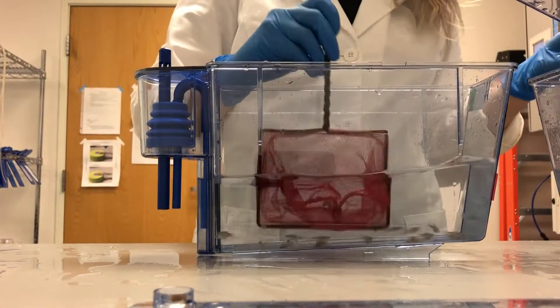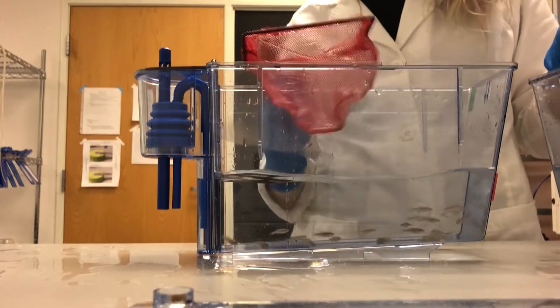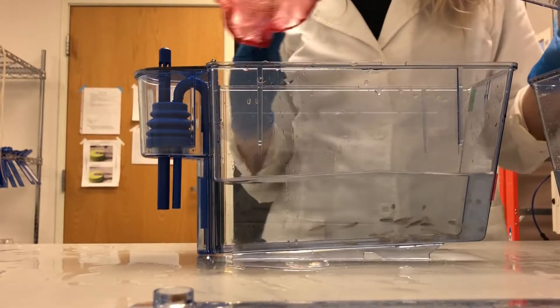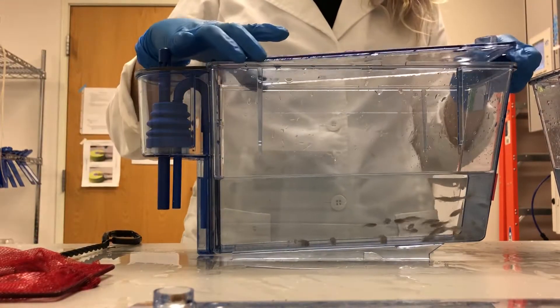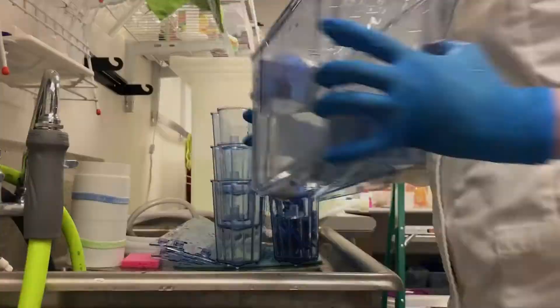Now that we've transferred all of the fish into the new clean tank we can put this clean tank back up on the rack and start the water flow again and we will move on to bleaching and cleaning the old tank.